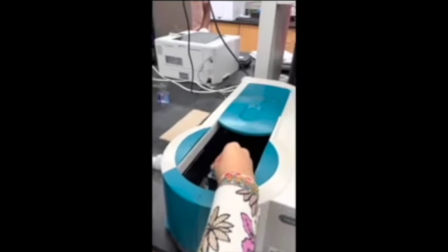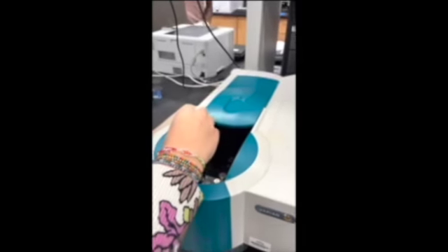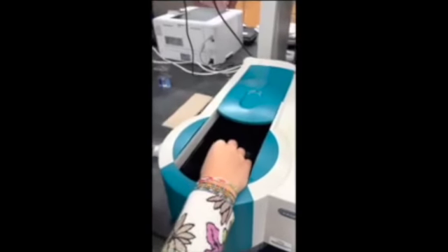Oh, doesn't this have to go in? Doesn't this arrow have to go in this direction? I don't know. It does. Well, which direction? Yeah, yeah, you're good. Agreed.